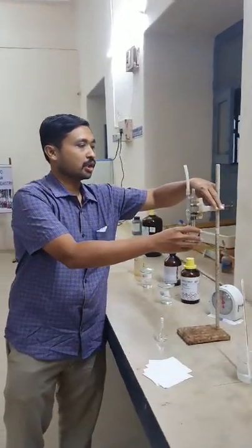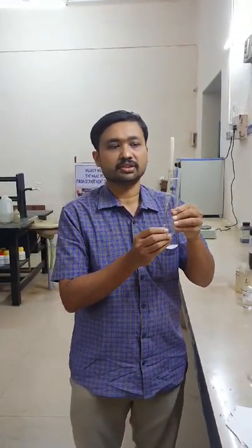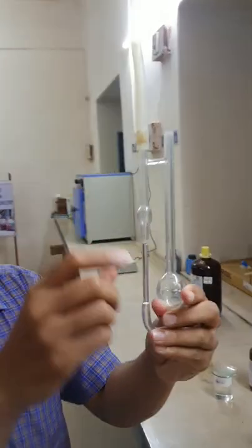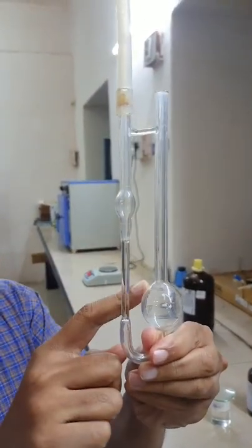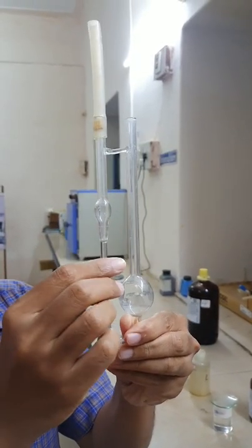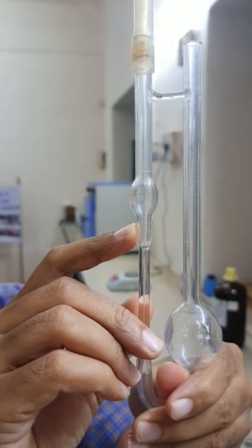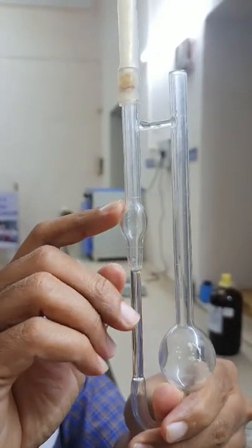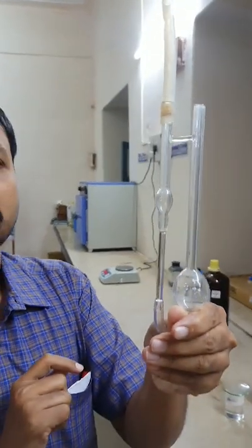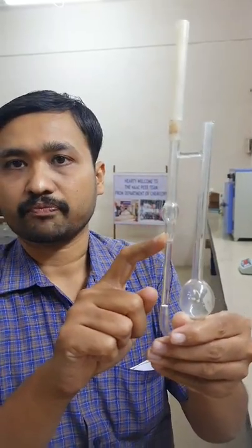Now let me demonstrate how to measure the time of flow using the Ostwald's viscometer. As you can see, the Ostwald viscometer is a U-tube type apparatus containing two bulbs — a larger bulb in which the liquid is taken, and a smaller bulb. If you carefully look at the smaller bulb, there are two marks: a lower mark observed here as a white thread, and an upper mark which is above the bulb. We measure the time taken for the flow of liquid from the upper mark to the lower mark.